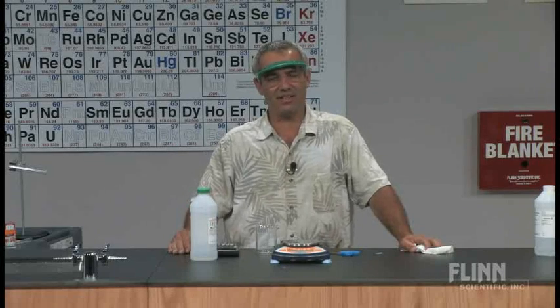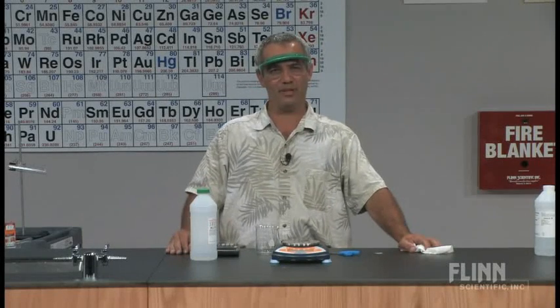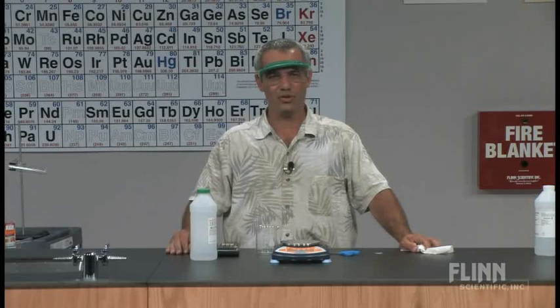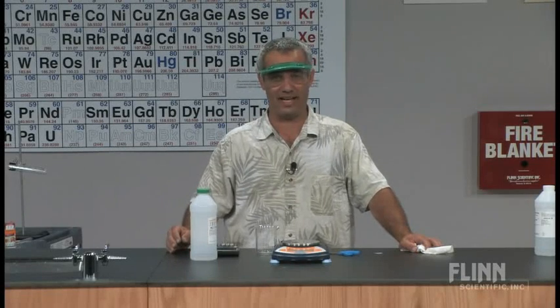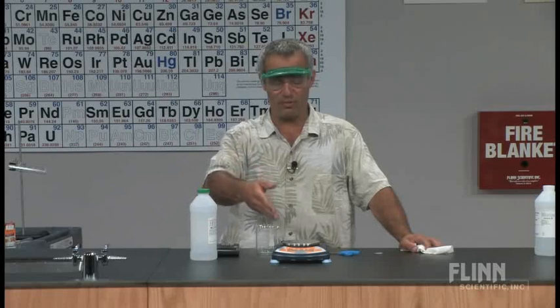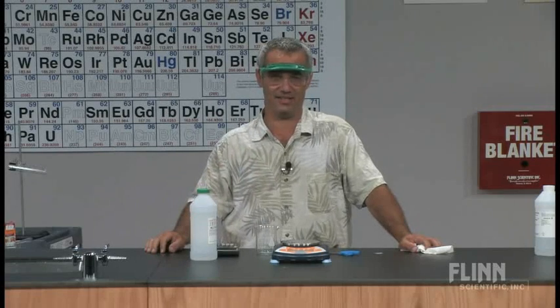This is a kind of lab I call a target lab because students are going to be graded on how closely their predicted final answer is to the actual final answer, not by me, but as judged by the electronic balance.